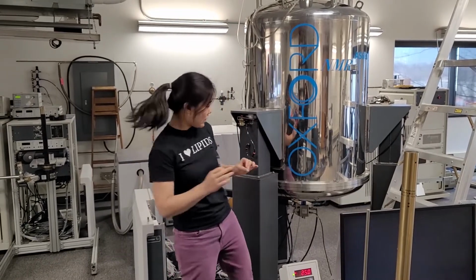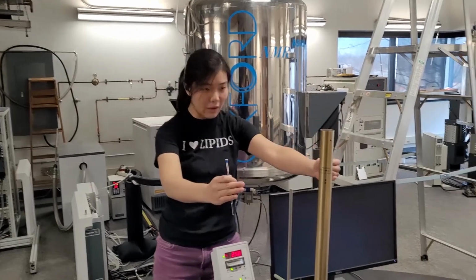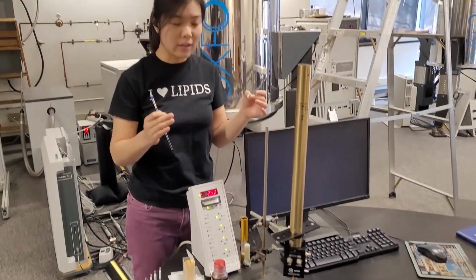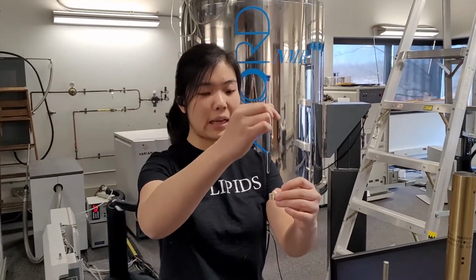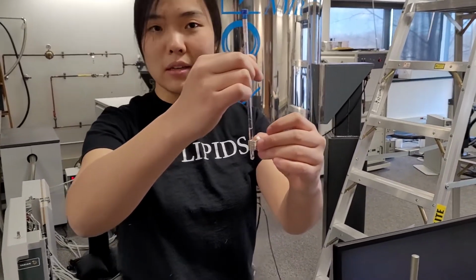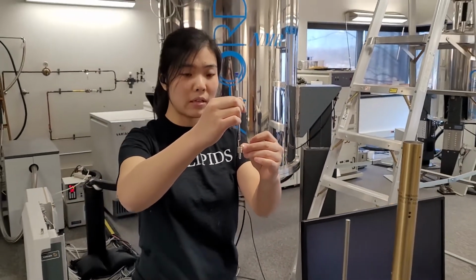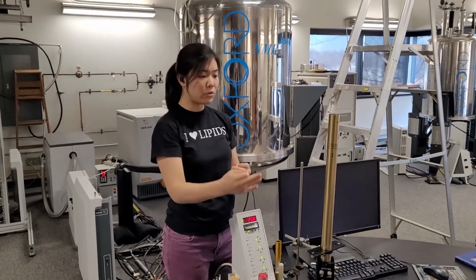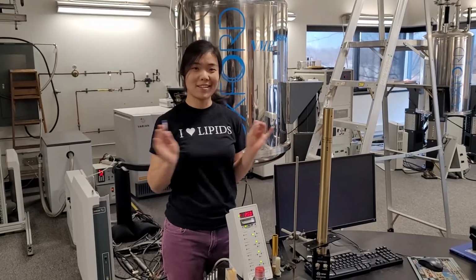Inside the magnet, there is a probe right here, which we have taken out here. So this probe contains special electronic circuits and radio frequency coils. So the tube is placed and surrounded by the coil, which will pick up radio wave signals from the sample. So the detected signals will be transferred back to the computer and analyzed. So let's get started.